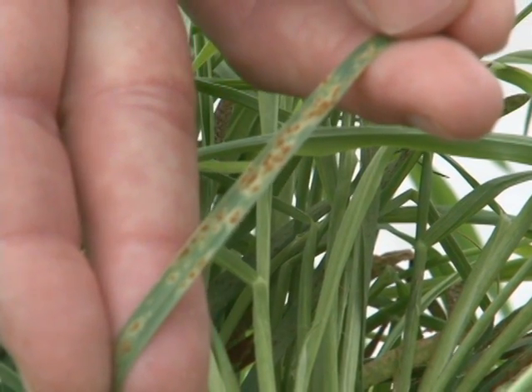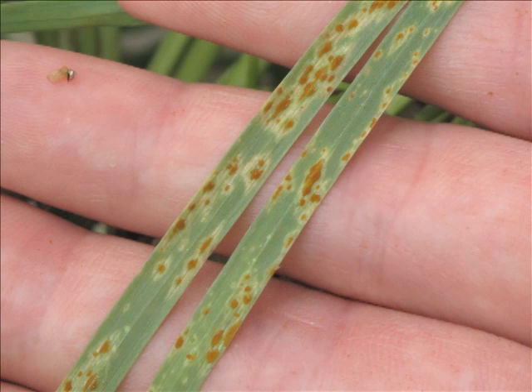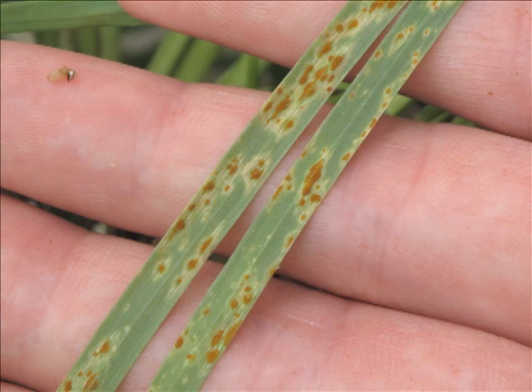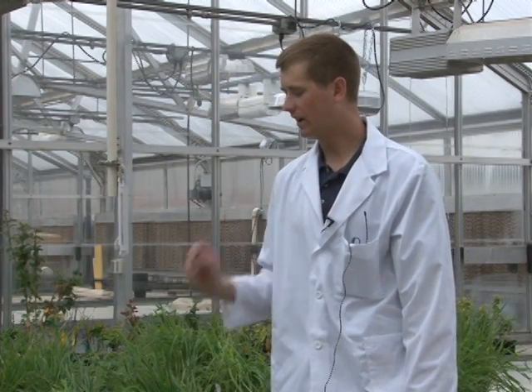When you look at the reaction at 20 to 22 degrees, you can see it is much higher — there are three infection types in addition to one infection types and a few fleck infection types. Another line to describe is SR13. SR13 is not one of the 20 North American stem rust differentials, but it is in the differential lines we use at the Cereal Disease Laboratory. SR13 is exactly the opposite of SR6 — more effective at higher temperatures and less effective at lower temperatures.